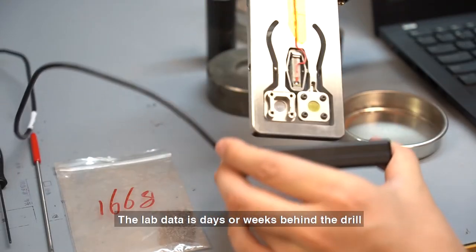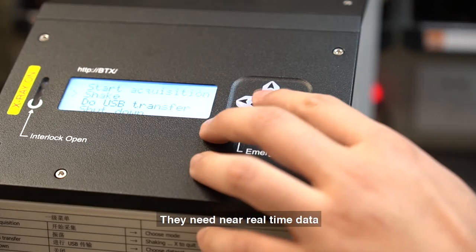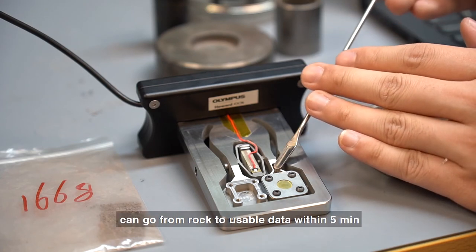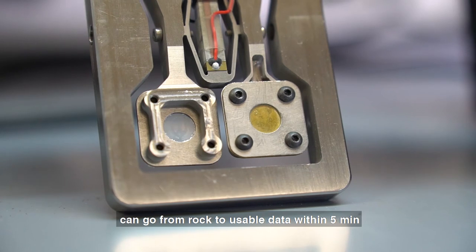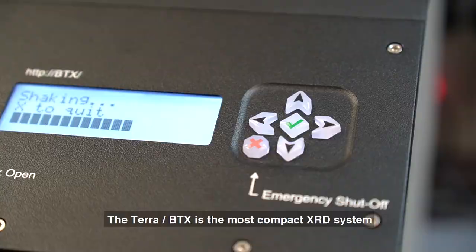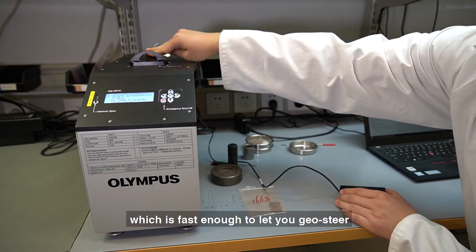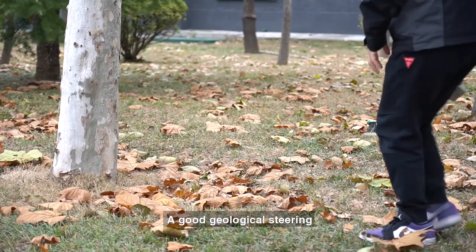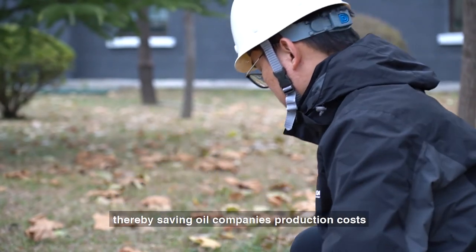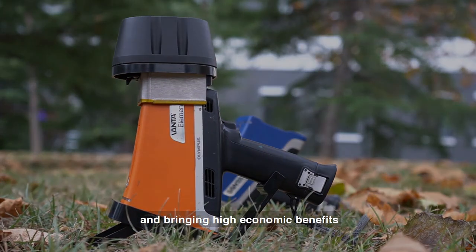The lab data is days or weeks behind the drill, so it can't be used to steer — they need near real-time data. Olympus XRD and XRF can go from rock to usable data within 5 minutes, which is fast enough to steer. The Terra or BTX is the most compact XRD system, fast enough to let you geo-steer. Good geological steering lets the drilling process proceed safely and quickly, saving oil companies' production costs and bringing high economic benefits.